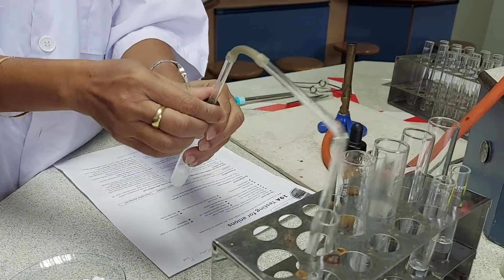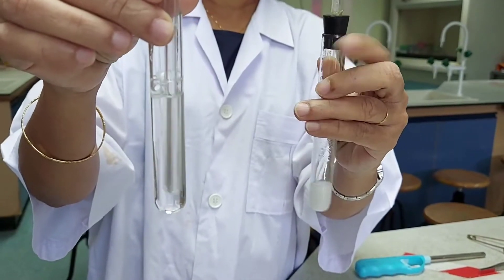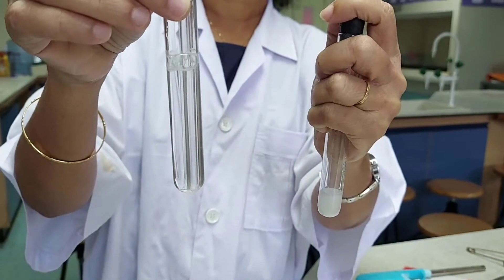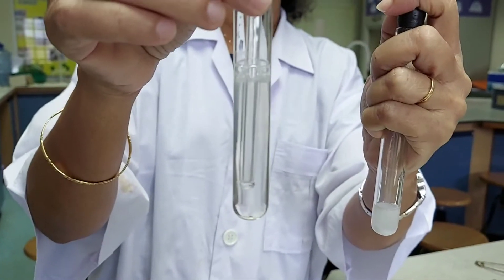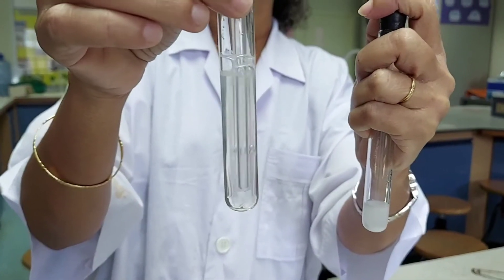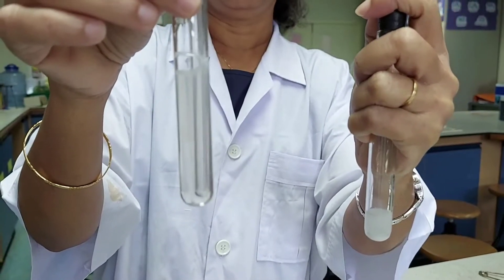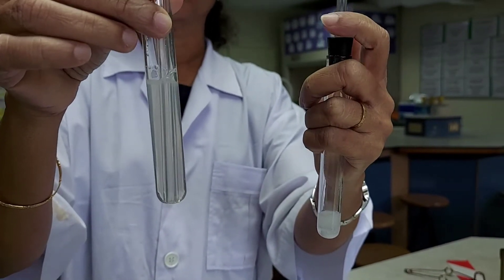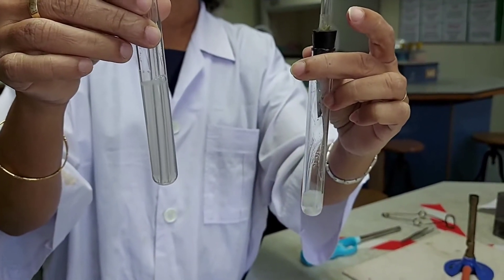This gas I will pass through lime water. You can see that as carbon dioxide bubbles through the lime water, the lime water is turning cloudy or milky, which is a test for the presence of carbon dioxide gas. This is a clear indication that the given salt contains a carbonate ion.